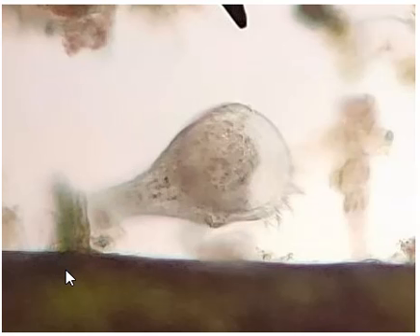It can also swim and can reproduce sexually, asexually by binary fission or by conjugation, according to Wiki. Like a planaria, it can also regenerate itself when cut in half. I will attach this video description to a video I made of a feeding stentor several years back.